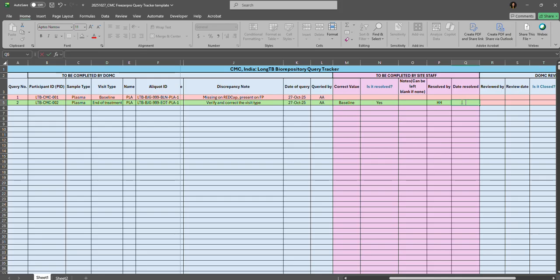Suppose it was resolved on 25th October 2025. Oh no, let's say 30th October 2025. That will be added here.